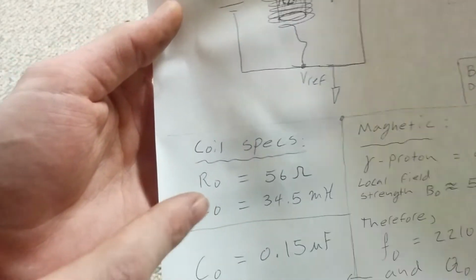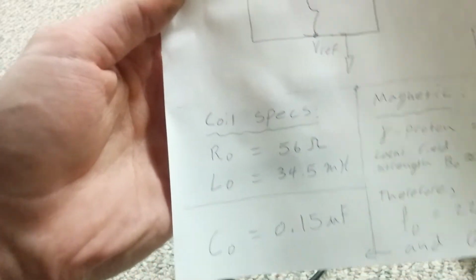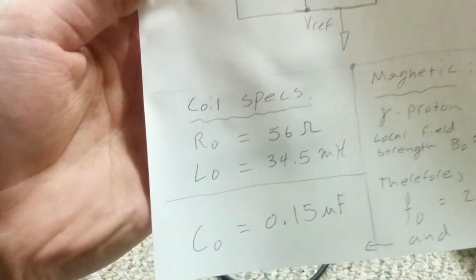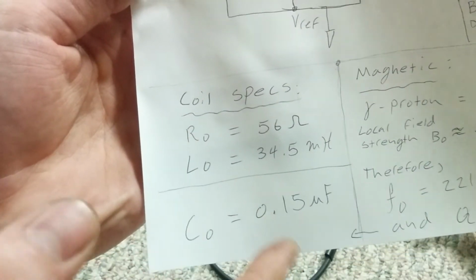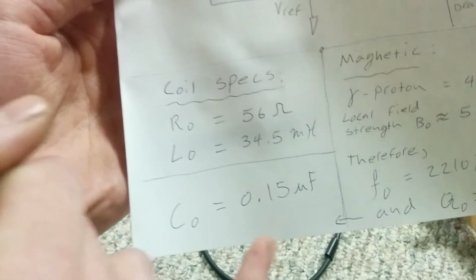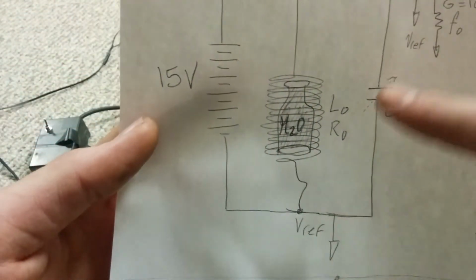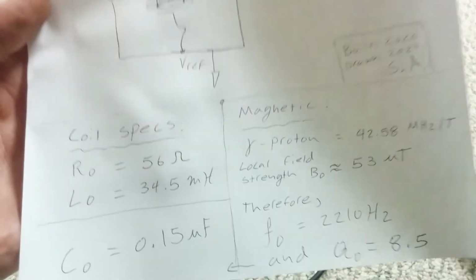So 56 ohm coil, 34 millihenry, and the capacitor was 0.15 microfarads. I actually trimmed that using some 220 pF parts and stuff to get it exactly dead on, but it's pretty close to 0.15 microfarads. And that's why I've drawn this as a variable. You'll have to figure that out. And so what frequency is that?